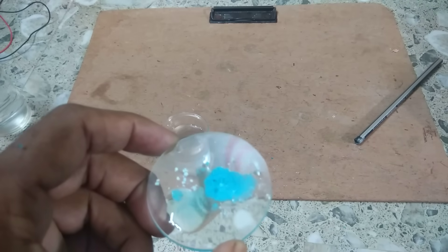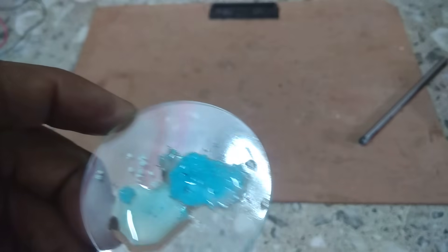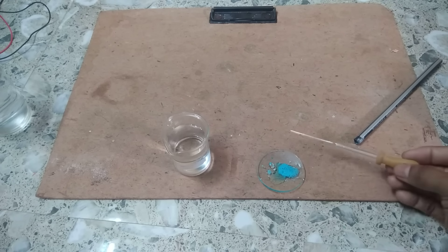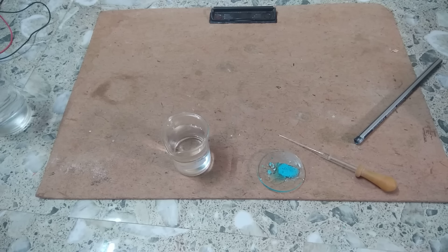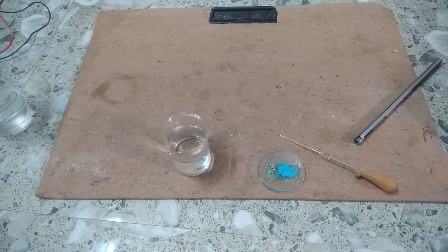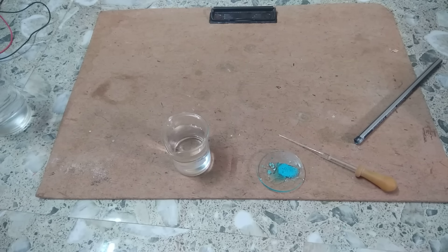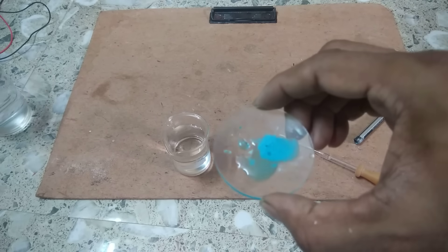When you heat the hydrated copper sulphate, CuSO4·5H2O, it loses its water of crystallization and turns white. And when we put water into this white anhydrous copper sulphate, it again changes into blue color. That means it is a reversible chemical change. The copper sulphate was blue at the start, and at the end we also get blue color of copper sulphate. Therefore, it is a reversible chemical change.